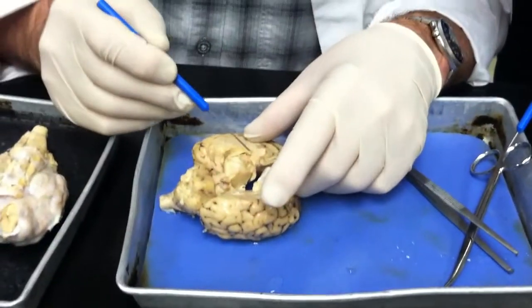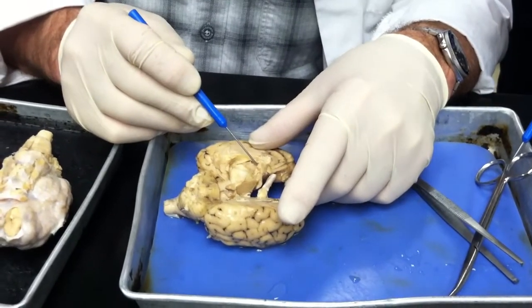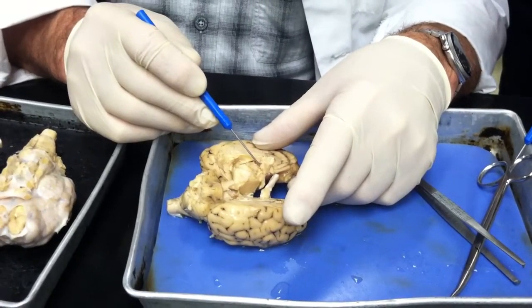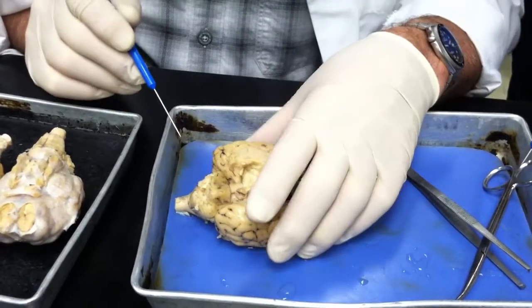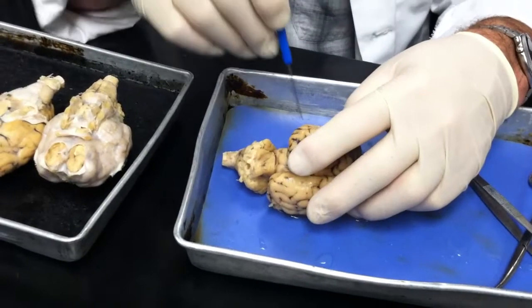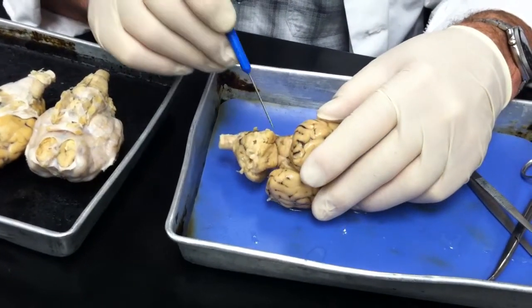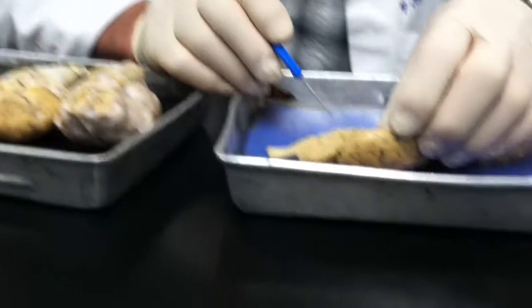The pineal gland, oh, there you can see it. It didn't get cut very well, but this little thing I'm popping up right there is the pineal gland. And just a couple of other features: the corpora quadrigemina, the superior and inferior colliculus. Let's see, we'll use this one. That one doesn't show it too well, but this one shows it pretty well, the sagittal section.